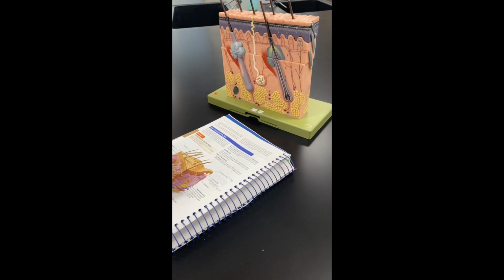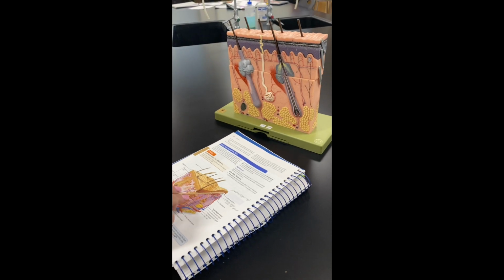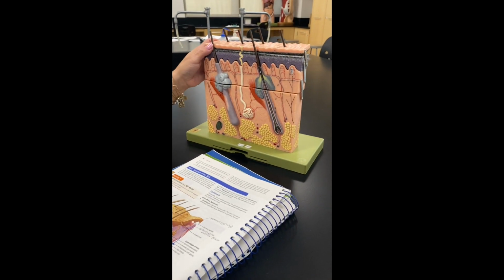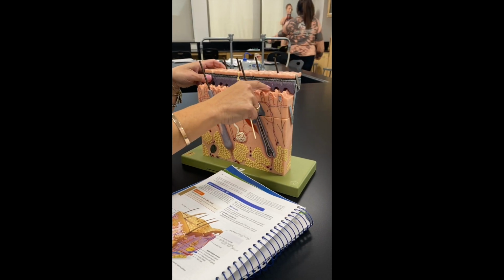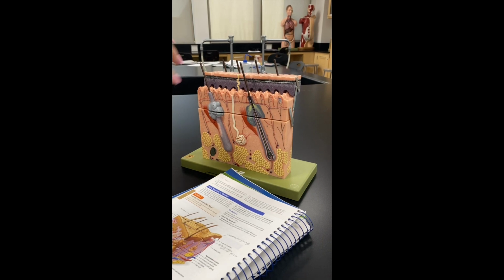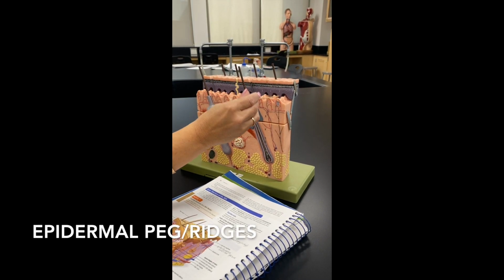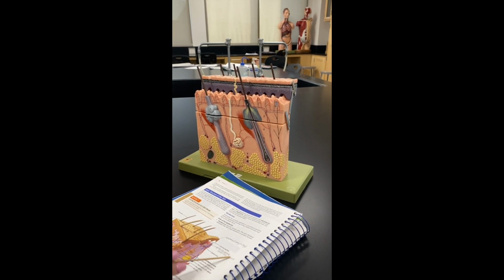Right, so I'm going to start and just go around the names, okay? And we'll try and identify everything. So these coming down, and you see how these coming up are your dermal papilla, and these coming down that are complementary are going to be your epidermal pegs or your epidermal ridges, okay? So then that's the dermal papilla.